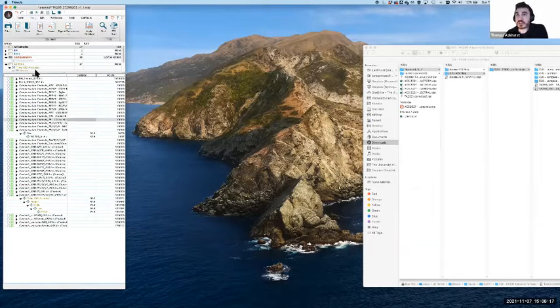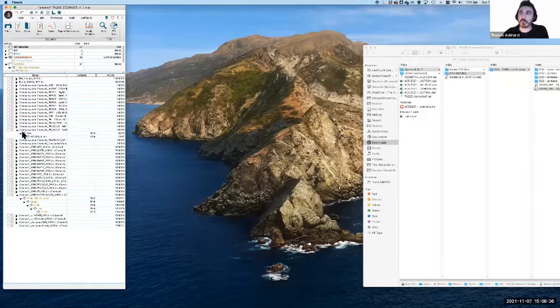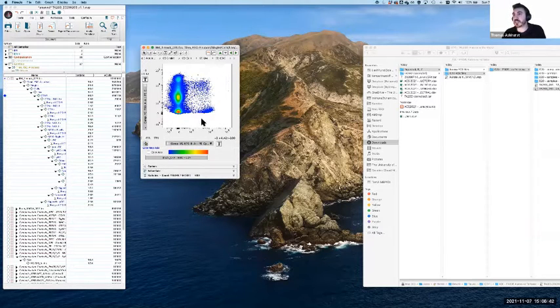There is a third situation which we'll come across, and then we're going to have a look at a few bespoke, kind of weird tricks with how this works. But the third classic, which we talked about before, is the spreading error. This one is a situation which we don't necessarily have a solution to. It's more like something that tells us there's something wrong, and then we need to go back and think about how we want to deal with that. So same sort of situation. Take away those gates because we don't need them anymore.